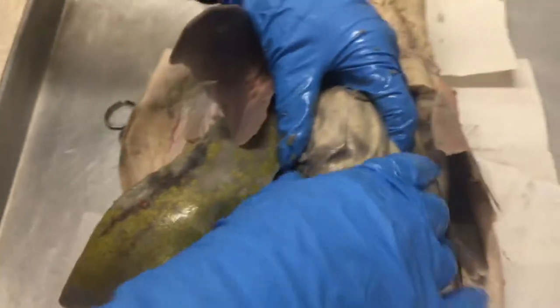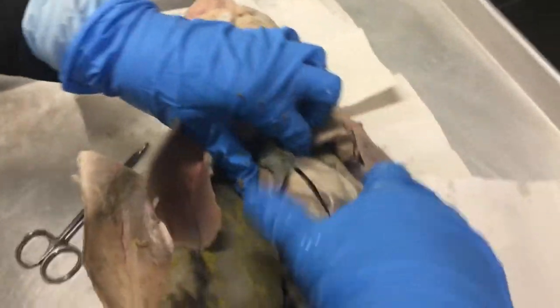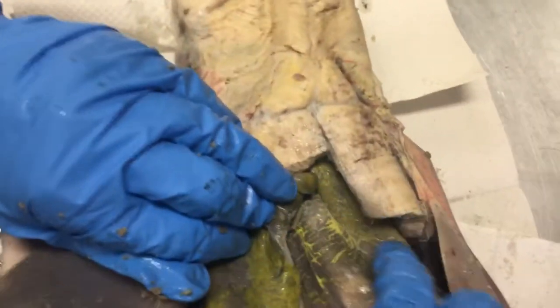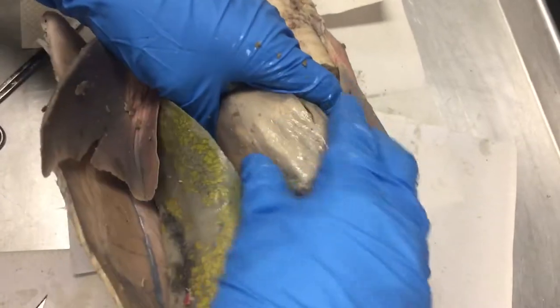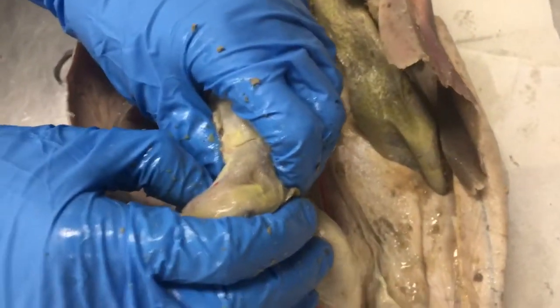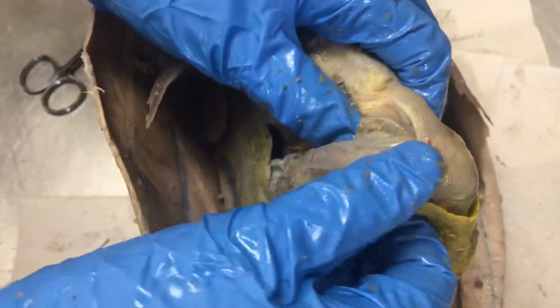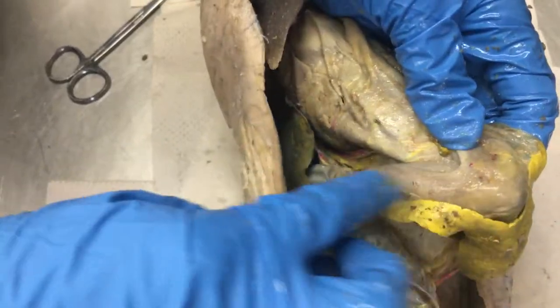Those folds are the rugae. We have the cardiac area of the stomach up above — the region where it first comes in — then the body of the stomach, which is the largest region, and then the pyloric area, which curves down. It's curved kind of like a J.